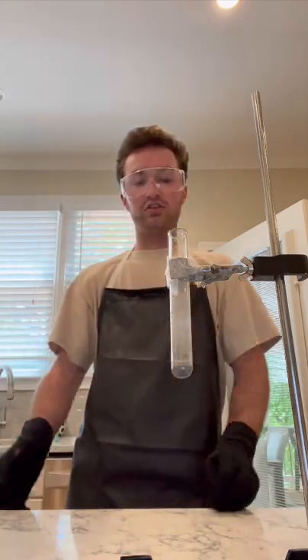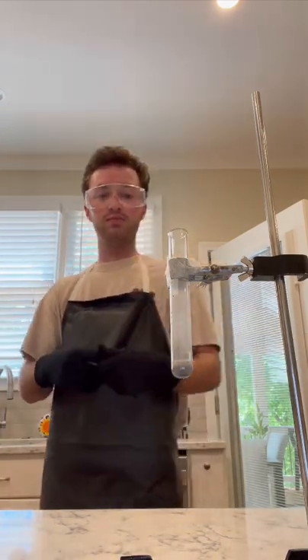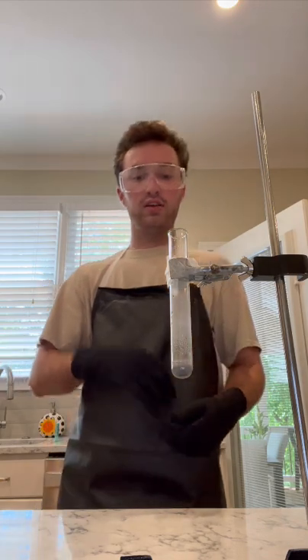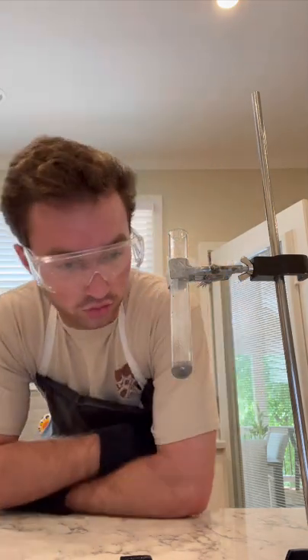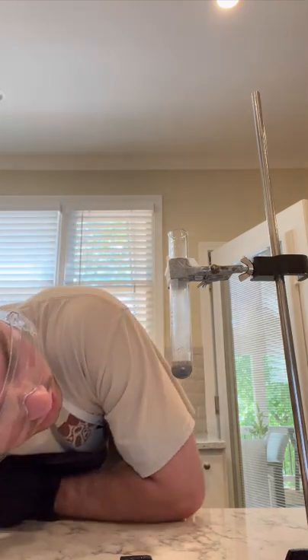And since the energy was released, just based off the fact that it's aluminum foil with HCl, we can kind of tell that the hydrogen ions from the HCl would get moved over to the aluminum, which would then make this a redox reaction, or oxidation reaction.